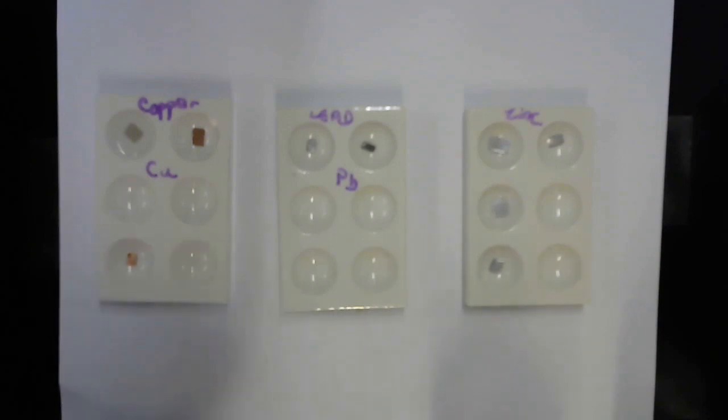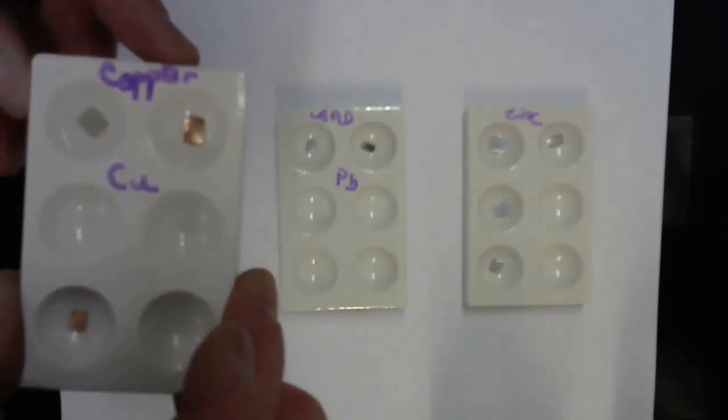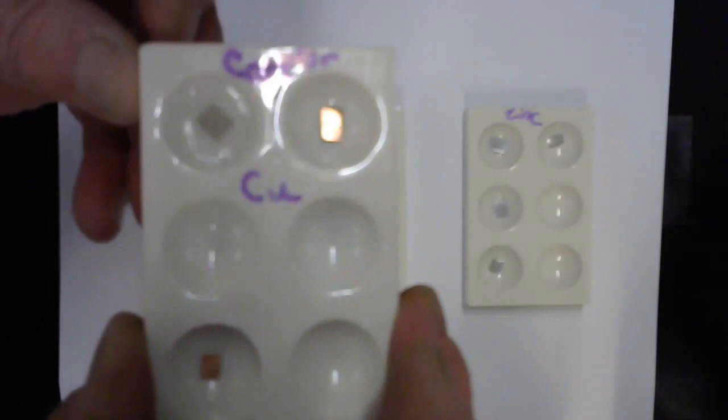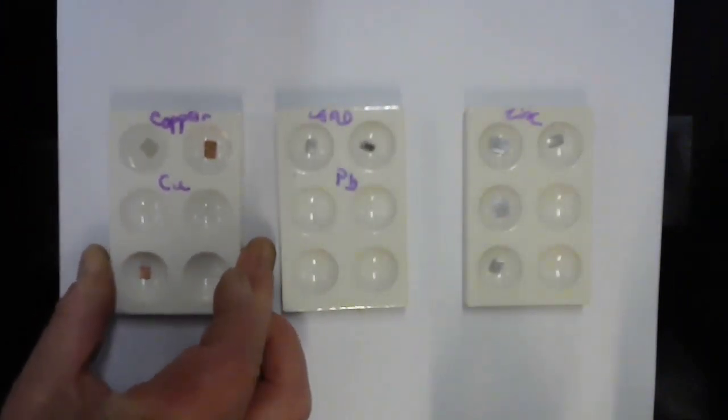That's reaction number one. Evidence of the reaction is a precipitate forming. And although it started off looking black, it's looking quite silvery. And you can't see this, but I can see these beautiful little needle-like crystals growing. I'm not sure this is going to work. I'm going to move the plate closer to the camera. Unfortunately, I think it gets out of focus, but you can see that the two look very different.